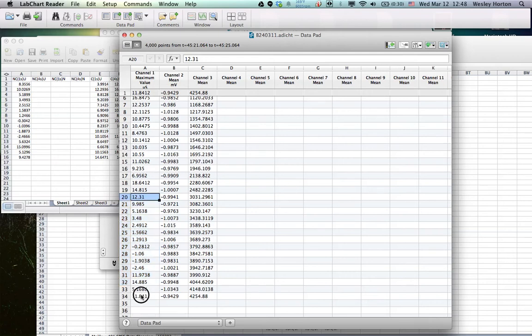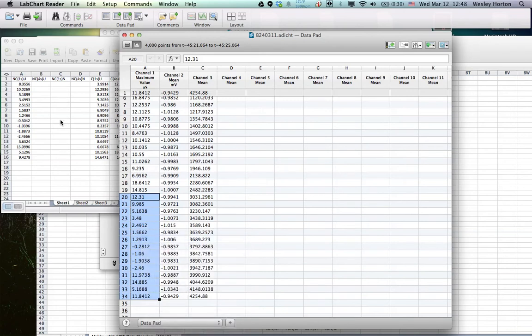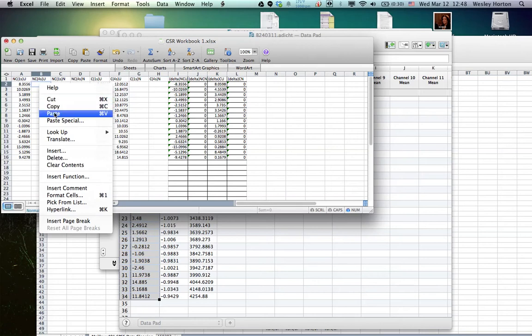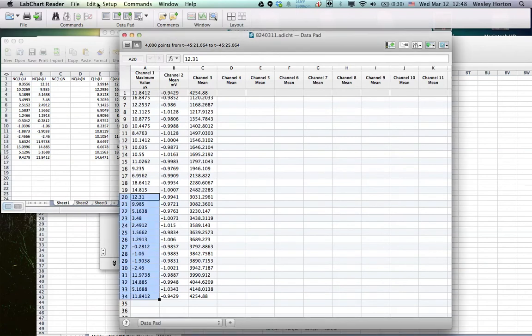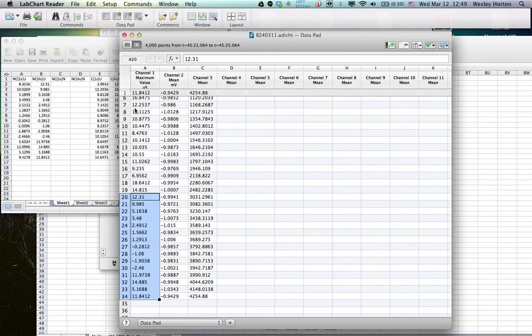Going to be non-SIBS. Alright, so now we're ready to change on over to the neutral stimuli. So we're going to do, let's delete our cells again just for cleanliness.